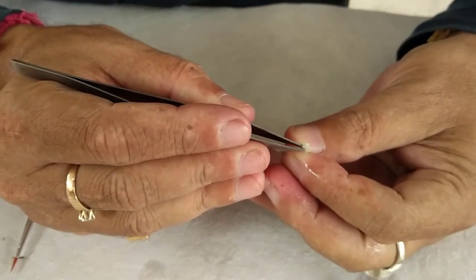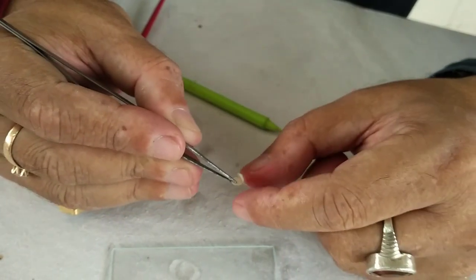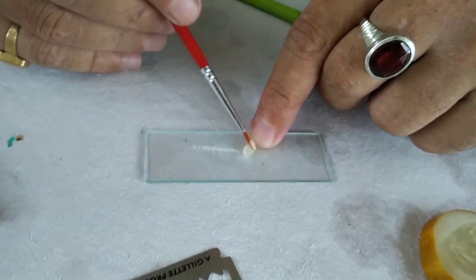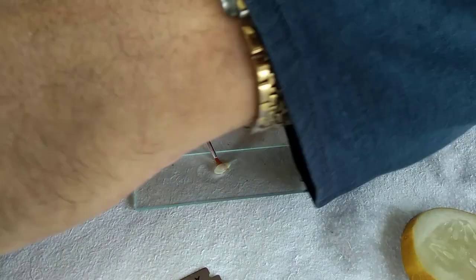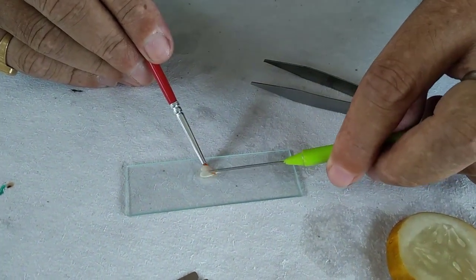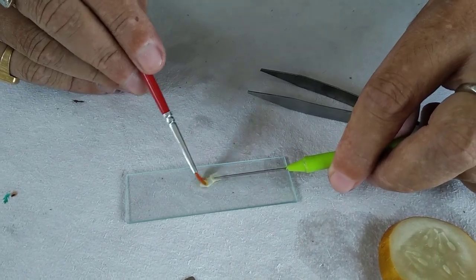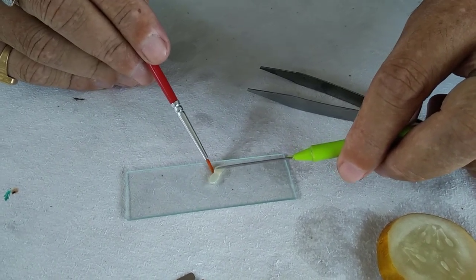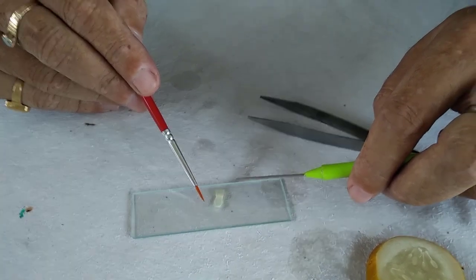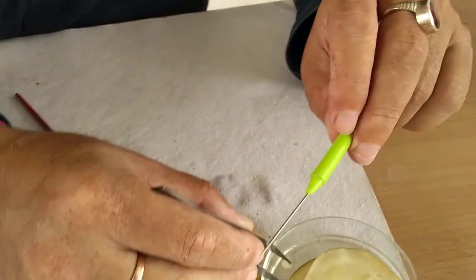Now you split open the seed like this. Take a brush, and now place it on the water drop. After placing it, you just brush it — remove the seed coat and just brush it like this. You see, once you brush it, the endosperm inside the seed will automatically start to float in the water. Is it clear? Then you remove the seed through it because you already have the tissue on the slide.